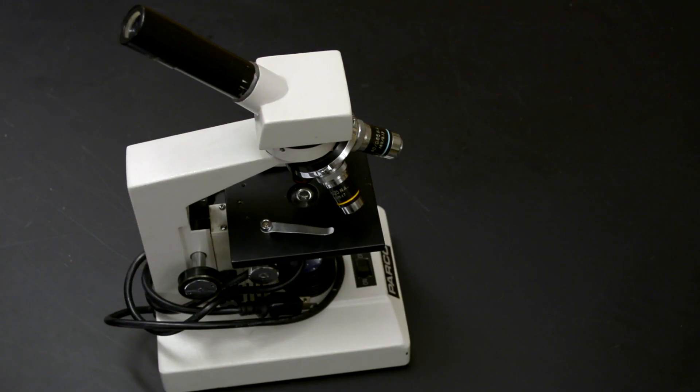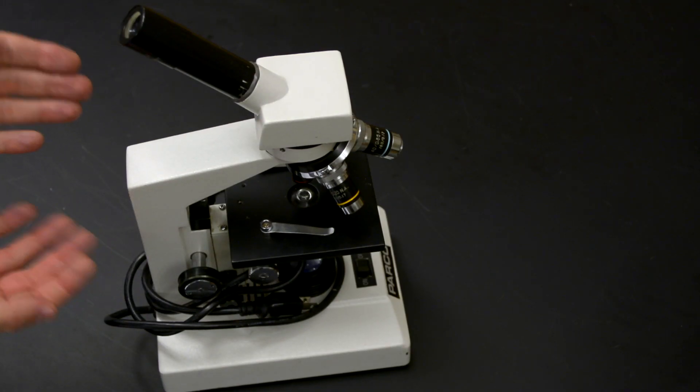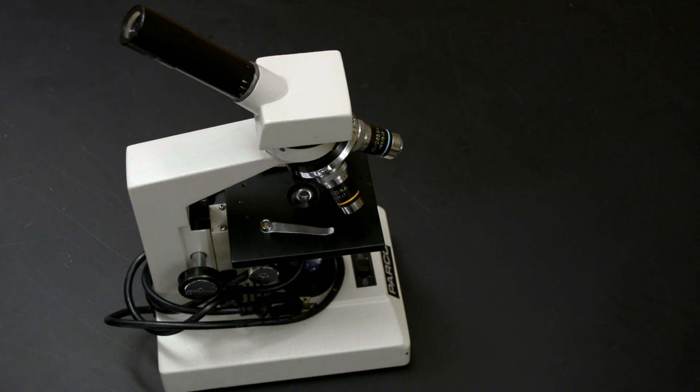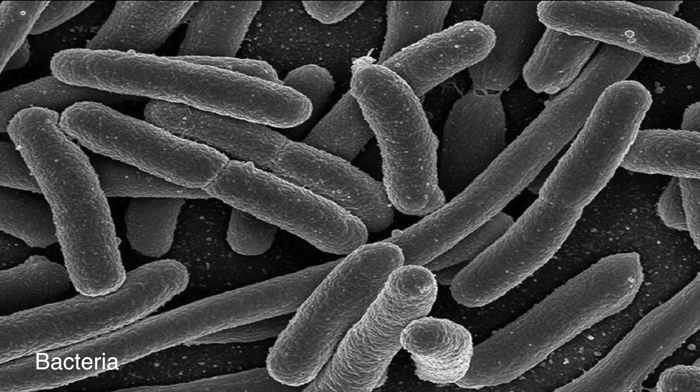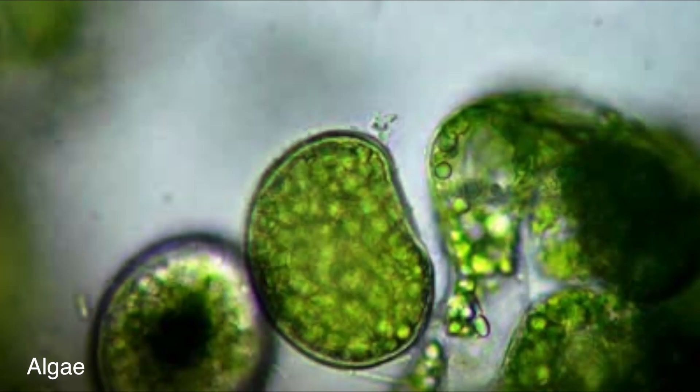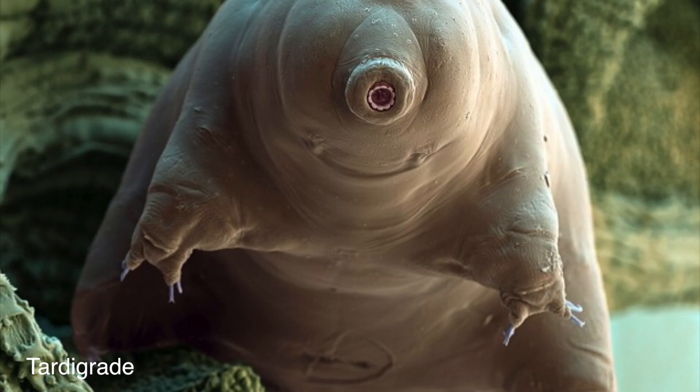One of the most familiar pieces of lab equipment is the microscope. This piece of equipment allows us to view the world of bacteria, algae, and other microscopic organisms.